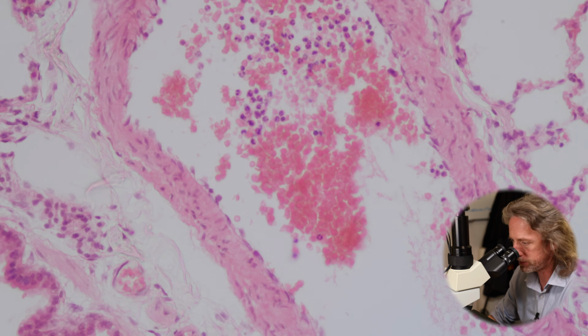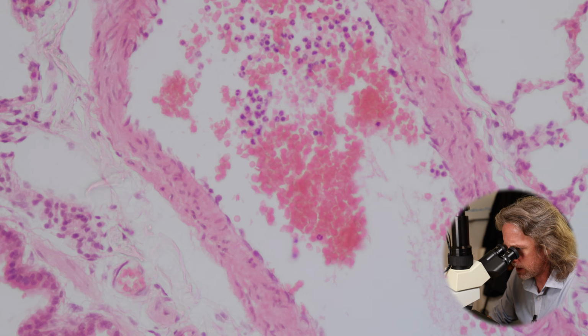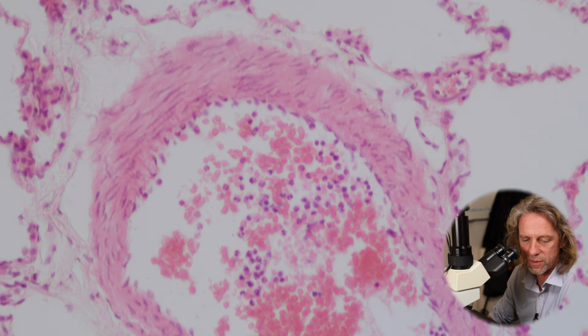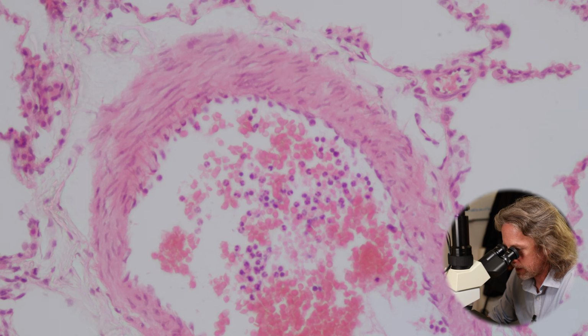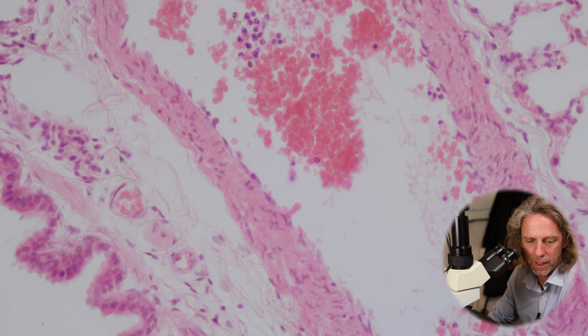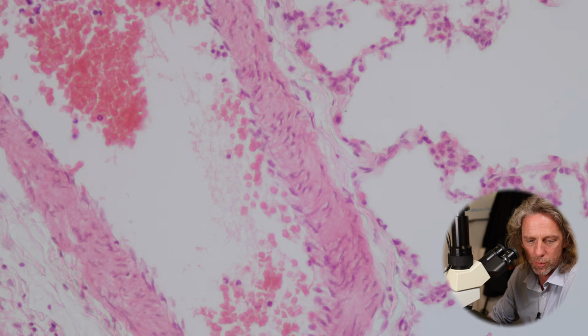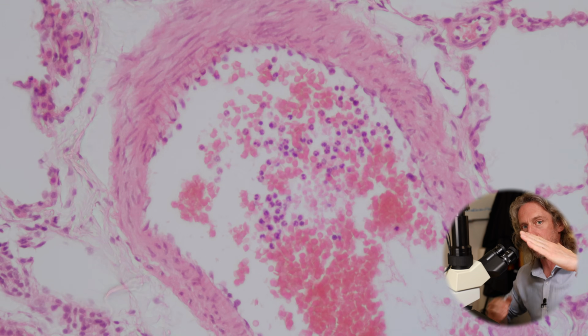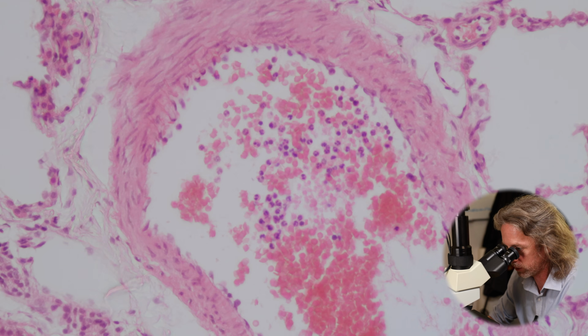and a little bit more light, we can see blood cells in there, but can you also see that this tube is lined by a single layer of thin flat cells? That's the endothelium. And then the cells around that are smooth muscle cells. We've got a bit of a glancing blow here because you see how we haven't got a circle, and blood vessels tend to make circles. So we've cut through the tube at a bit of an angle, which is why it looks like that.